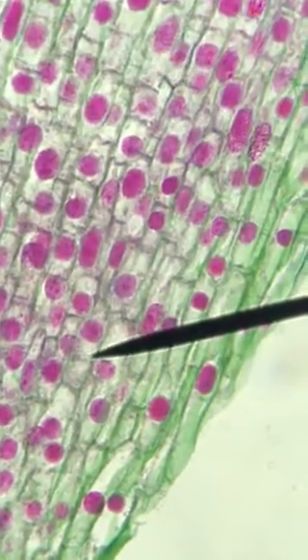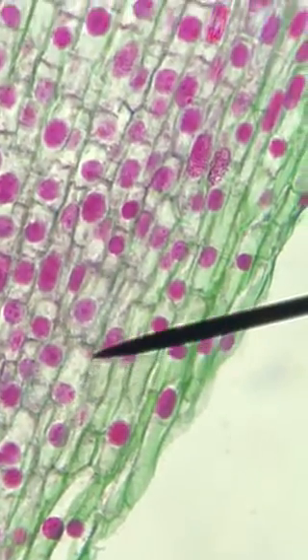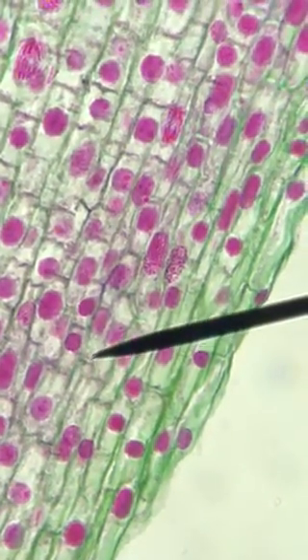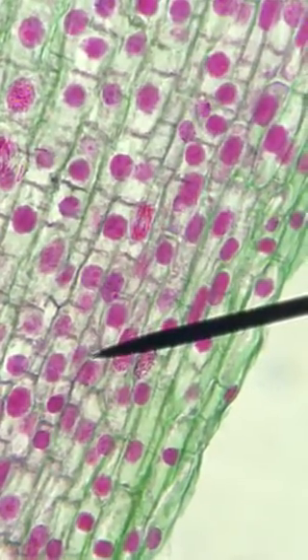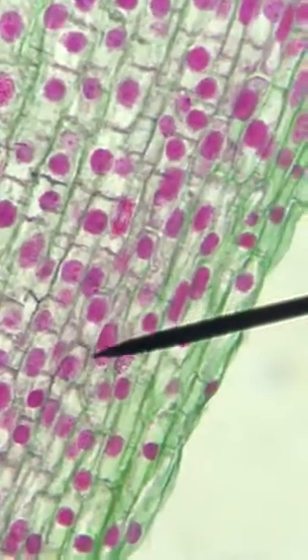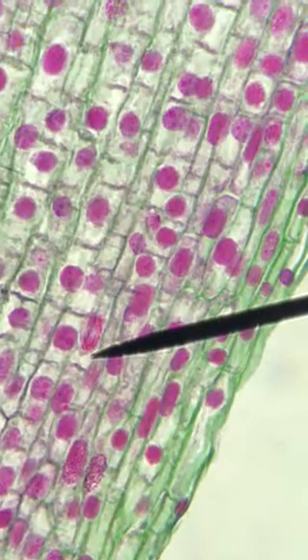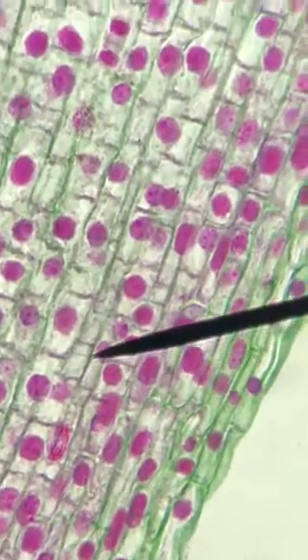Then we're going to move over again, just a few more here. You don't have to go to adjacent rows. You can just continue over maybe a couple of rows as long as you keep the pattern of up and down. So we're going to go over here. You can see that we've got a nice example of prophase coming up. It's sort of right there. Okay, so we're going to jump back into my original row. There we go. There's a nice example of anaphase. The cells are moving apart.